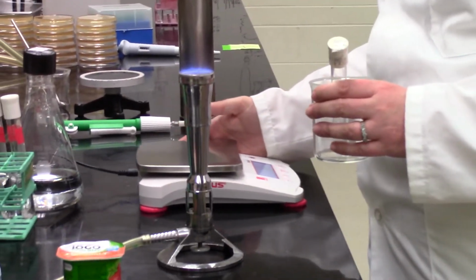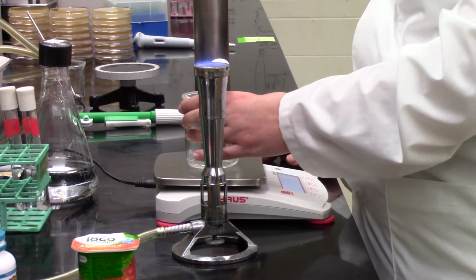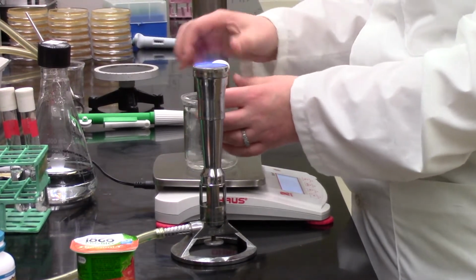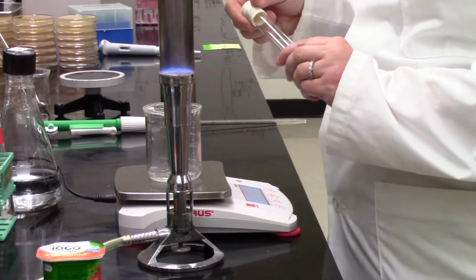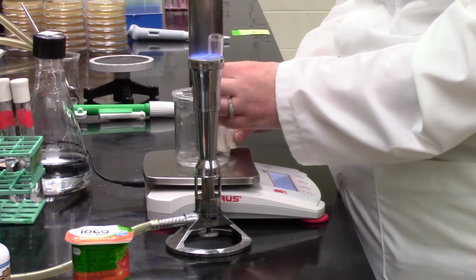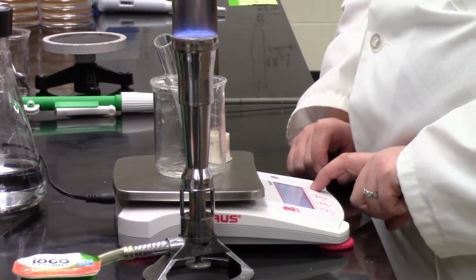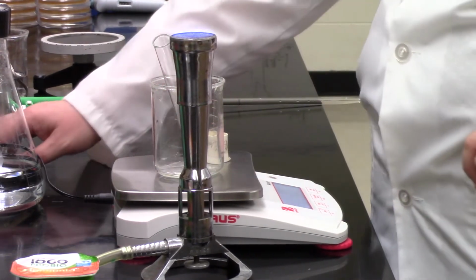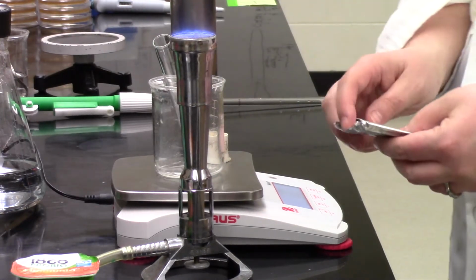So at this point, we're ready with that probiotic capsule sample. The next steps that you'll see are that being diluted and then going on to spread plates. Right now, Sabrina's going to show you how you would set up the yogurt if you were to use that. Because it's no point just adding a spoonful of yogurt in there and saying that's how many bacteria are in a spoonful. We want something more accurate.